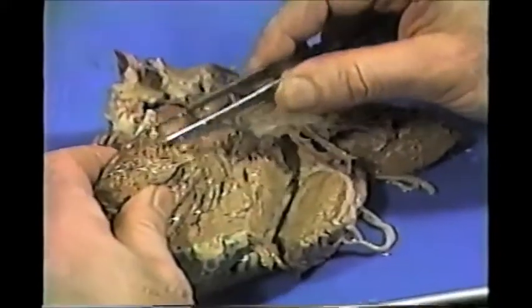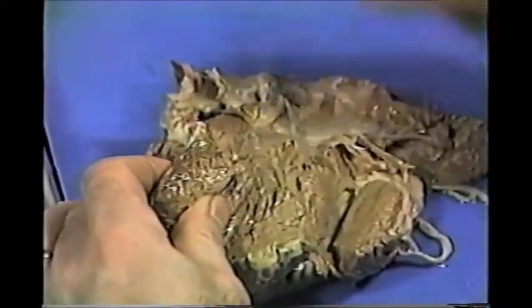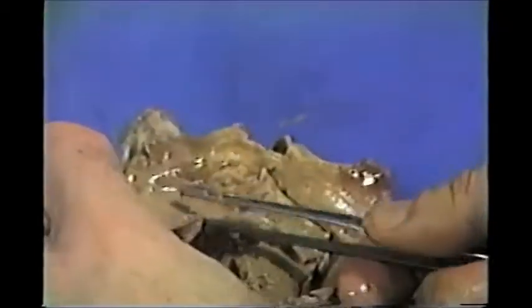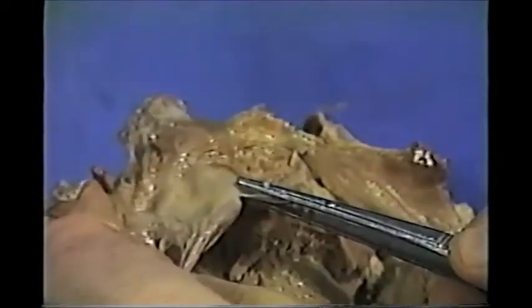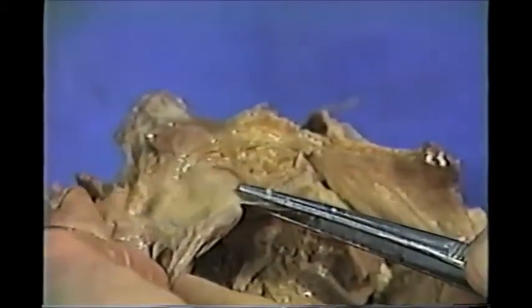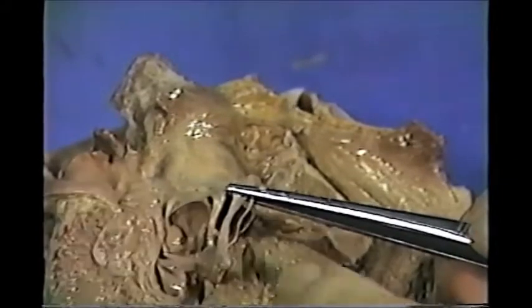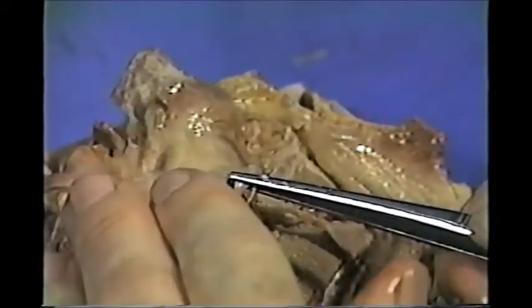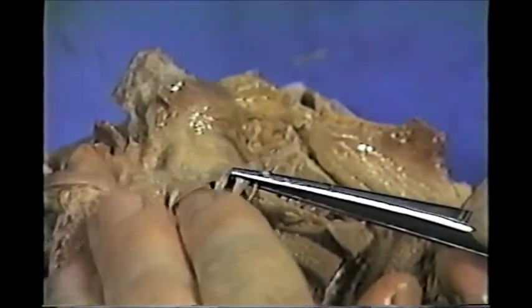If we turn this over and look at the left side, look how much thicker the left ventricle wall is. Let's take a look at the mitral valve or bicuspid valve flap — much, much thicker than the tricuspid valve flap. If we look at the chordae tendinae, they are much more prominent, and the papillary muscles are bigger. So everything's heavy duty because of the increased pressures on the left side.